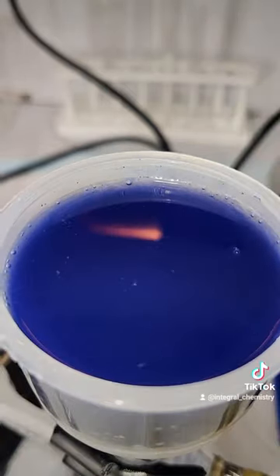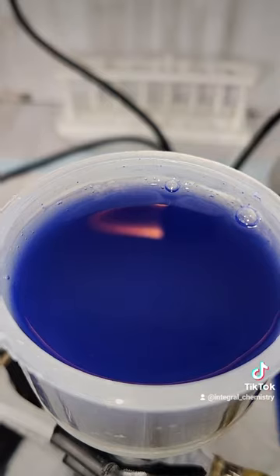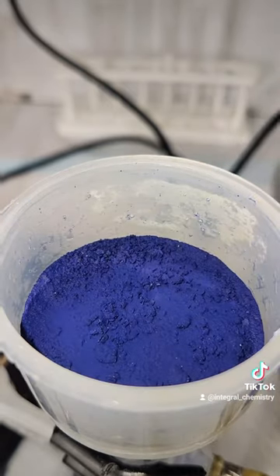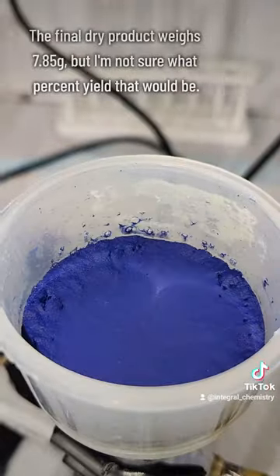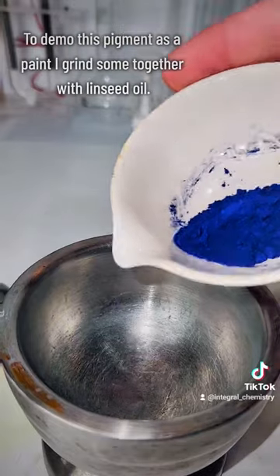This left me with the clean and pure pigment you saw at the very beginning of the video, and my final yield was exactly 7.85 grams. I'm not exactly sure what the percent yield on that would be, but I'm happy with the results.